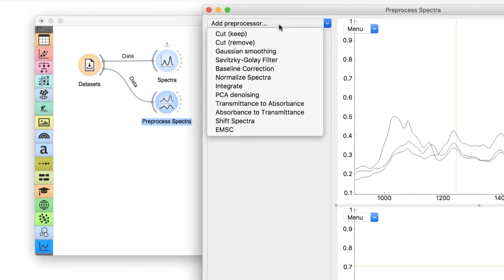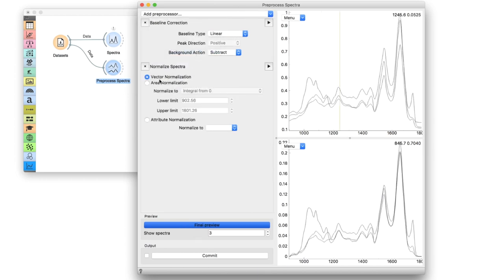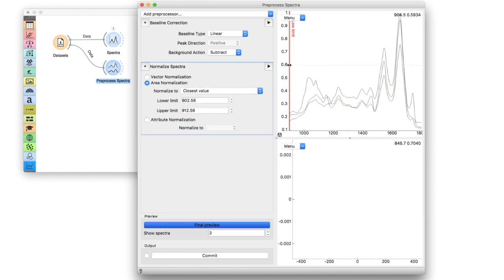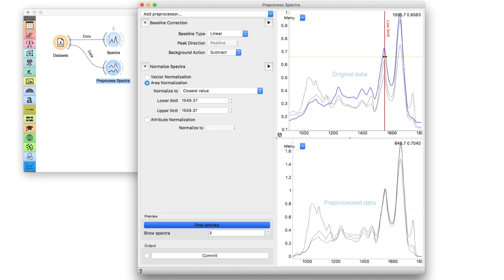Let us add a preprocessor from the top left menu. Say, baseline correction. You immediately see the effect on the right. Now the spectra in the bottom are better aligned. We will add a couple more preprocessors to create a simple preprocessing pipeline. Say, normalize spectra. We will use area normalization with the closest value. We can drag the red line to select the X value, at which all the spectra will be normalized. Look at the effect in the bottom plot.